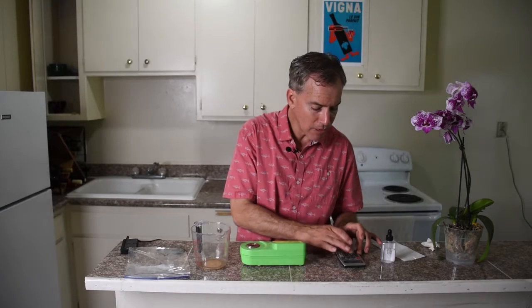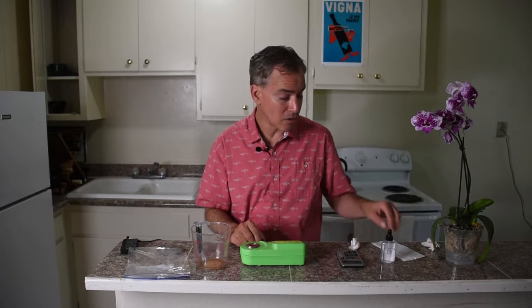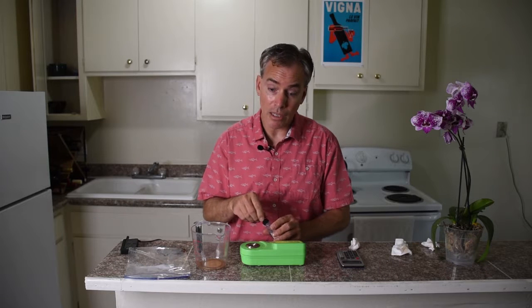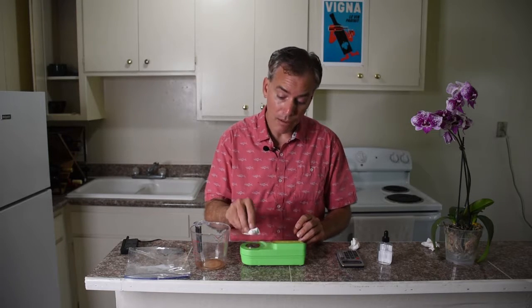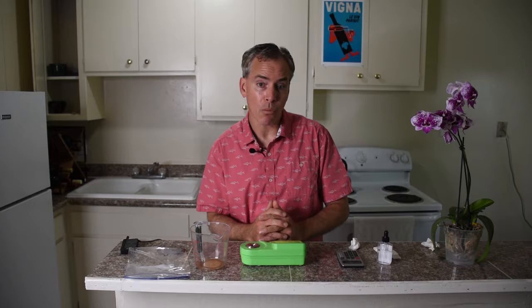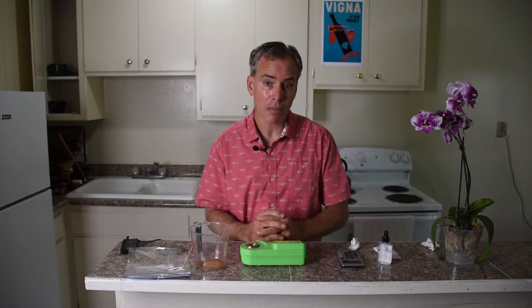So again, 20 times 0.55 puts us at about 11% alcohol. For Pinot Noir, we really want to be probably in the 12% range. Once we get into 13 and 14, you need to do a lot more diligence in your winemaking process — the higher the alcohol, the clumsier your wine tends to get. Traditionally, Burgundy Pinots tend to be lower alcohol, while for example Santa Lucia Highlands in the Monterey region tends to have higher alcohol. All winemakers have their own decision about what they want to do with their pick, depending on wine style and other factors. Using a refractometer is certainly a good tool to help you as a winemaker make those big decisions.